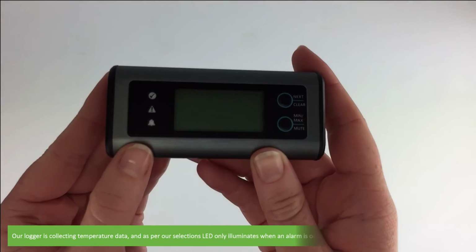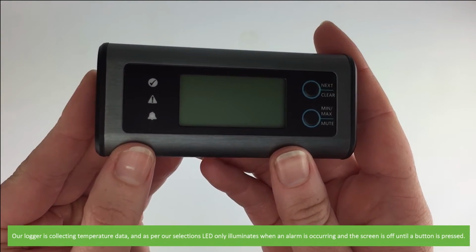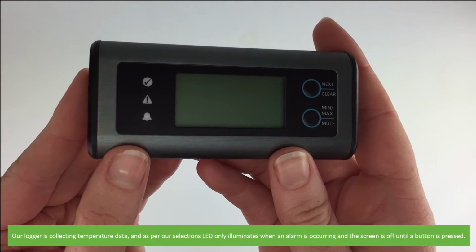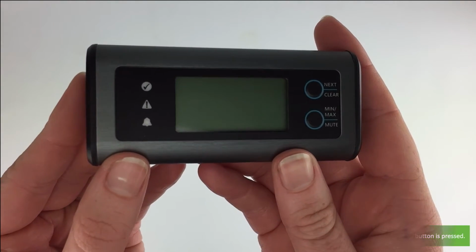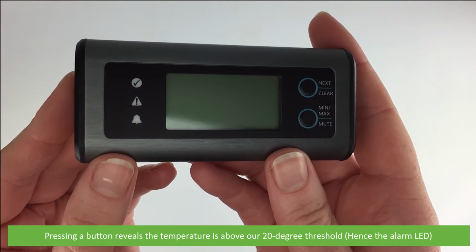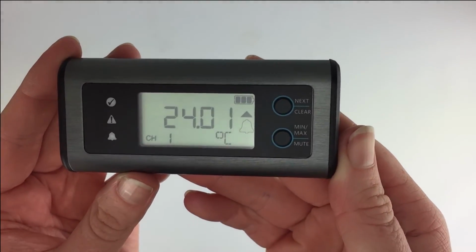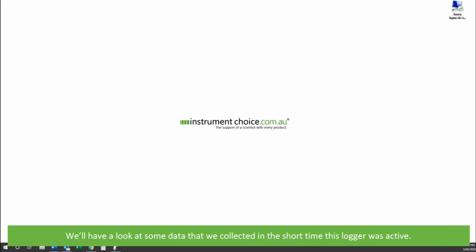Our logger is collecting temperature data, and as per our selection, the LED light only illuminates when an alarm is occurring, and the screen is off until a button is pressed. Pressing a button reveals the temperature is above our 20-degree threshold. We'll have a look at some of the data we collected in the short time this logger was active.